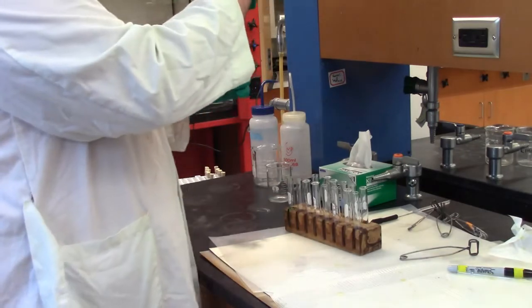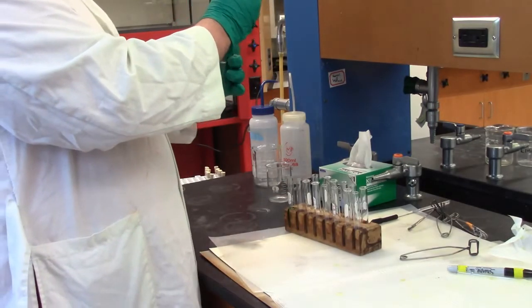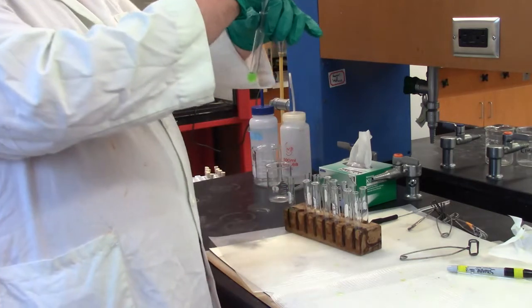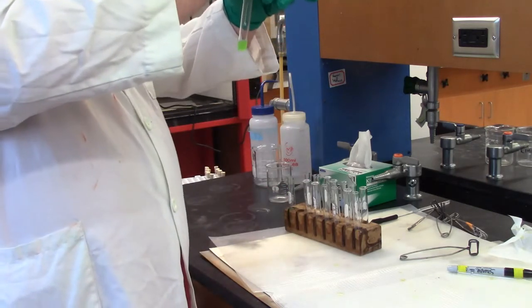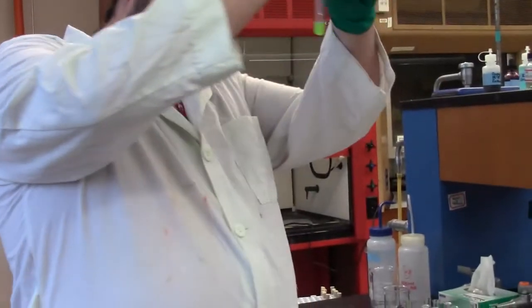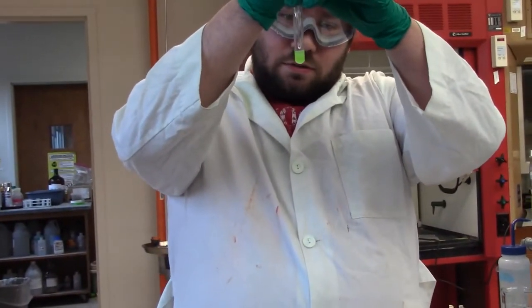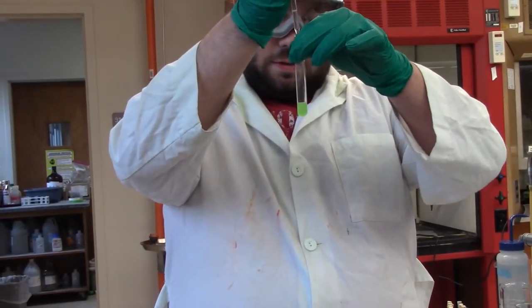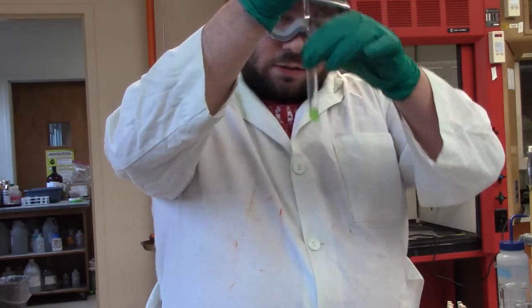Just made it. There it is. Put a few drops in there. And it definitely is a bit cloudy. So we'll call that good.